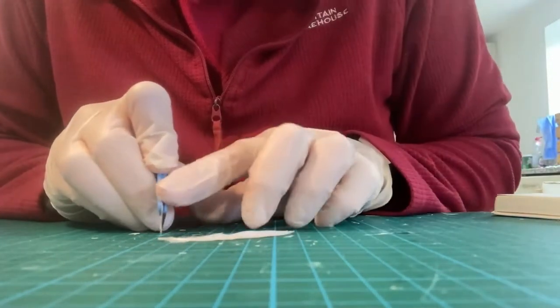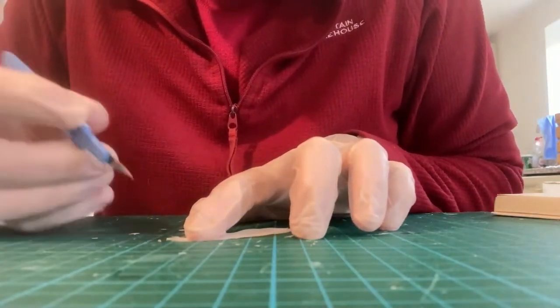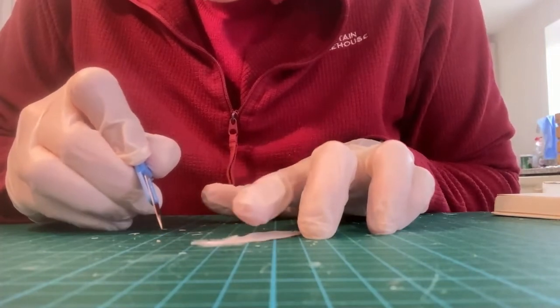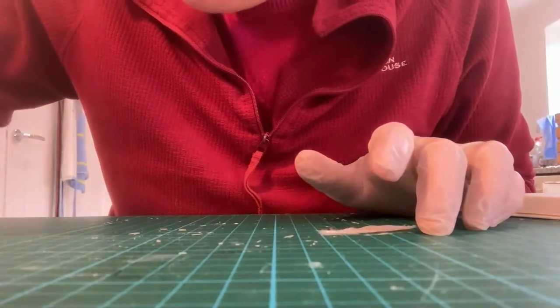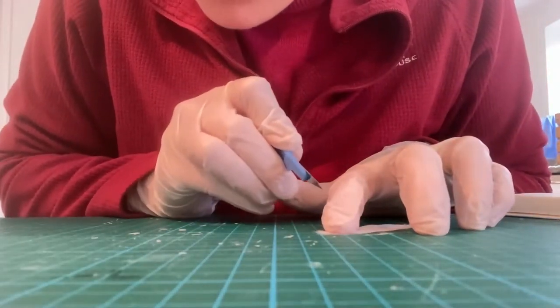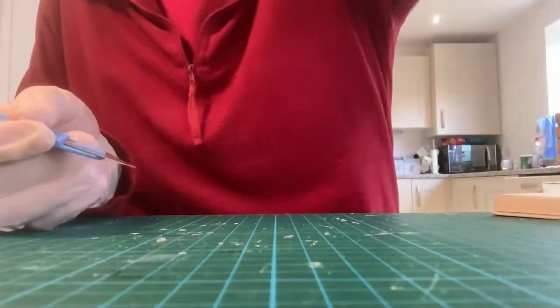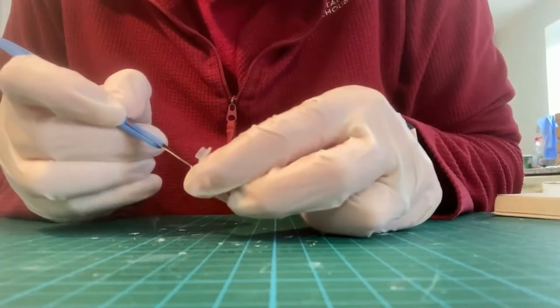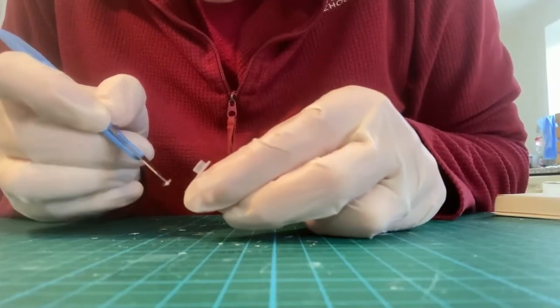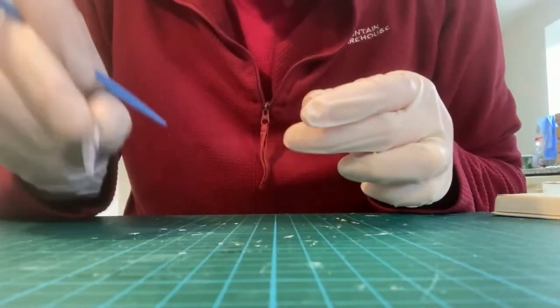To maximize my chances of getting DNA, I'm taking the tip — there's always a danger of a little ping where the bit you want goes flying off, but that didn't happen. Now I'm taking out the hollow section — oh, that just went pinging across my workbench — and now I'm taking the base of the feather as well. There we go, double chances of getting DNA from this one. You can just use the very tip of the scalpel to transfer those in, trying not to breathe too hard on the feather and send it flying across your cutting mat.